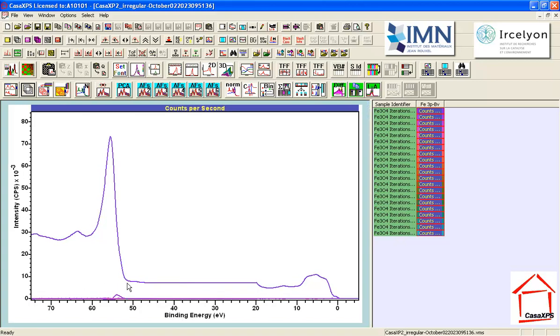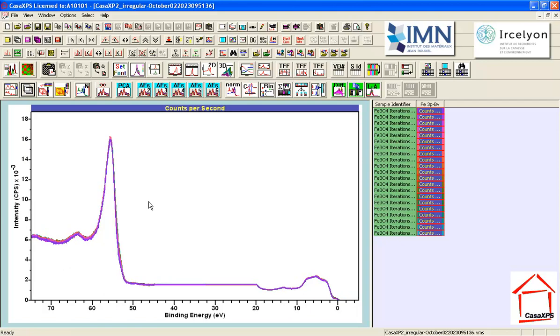I need to return the abstract factors to the original state, and then I believe that the third abstract factor may just be some oscillation in the measurement process, something that has evolved, not necessarily physically significant. And so I'm going to reproduce these data using just the first two abstract factors. And what that does is it makes sure that all of these data lie in a plane as opposed to a three-dimensional space. Higher dimensions, I'm assuming, are just noise. So the significant information I've gathered now into two abstract factors, and I've reproduced the data using the two abstract factors. So the next step is to look at differences between the first and the last.